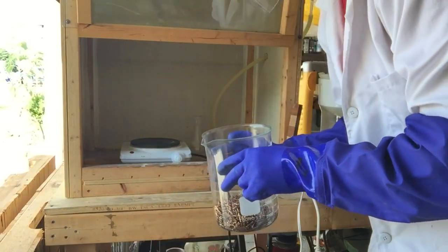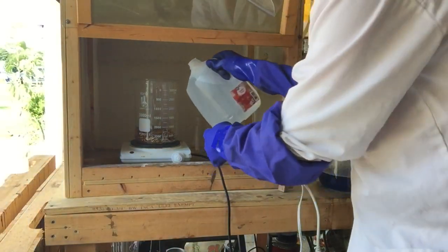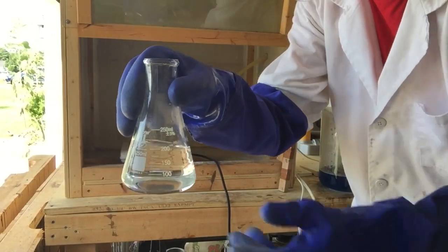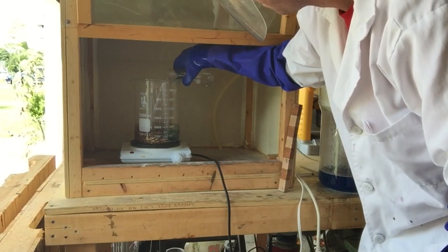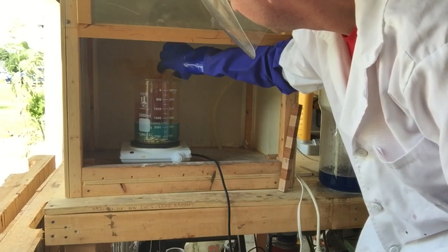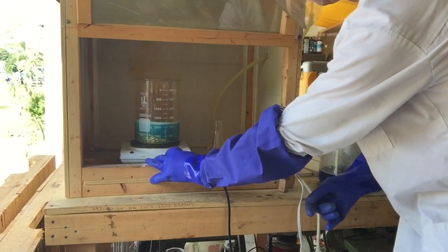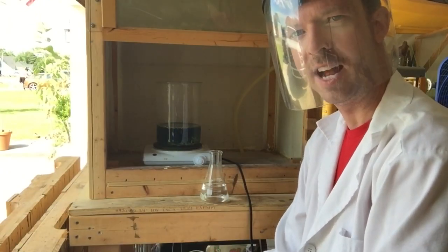We're going to hit it again with nitric acid — about 200 more milliliters. You might notice I put a little less water in this time. I'll turn on some heat and let it cook.